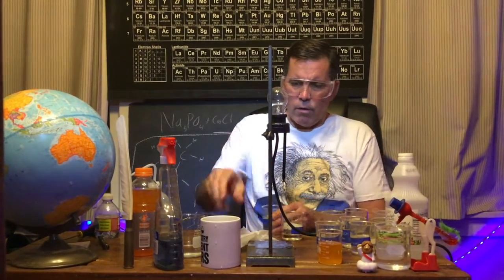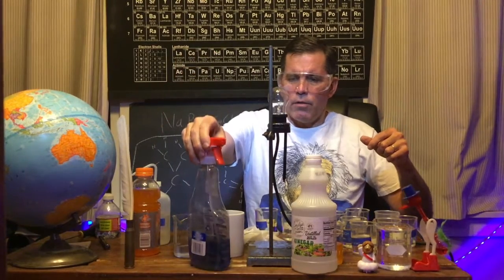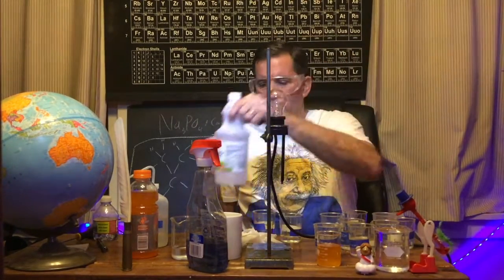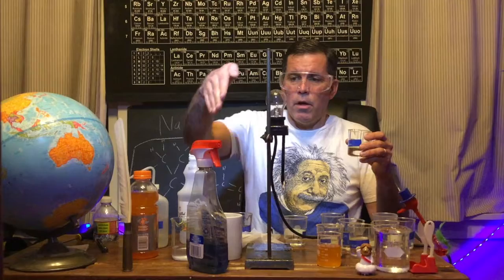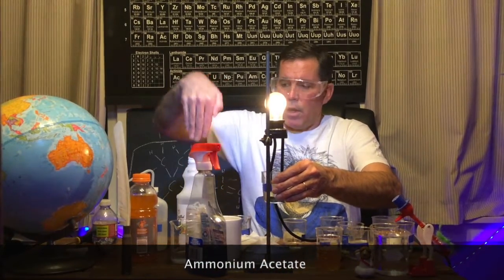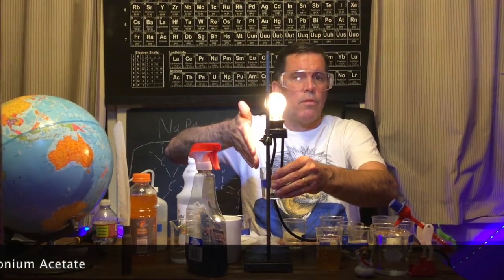What happens if I take the acetic acid in vinegar and the ammonia in Windex and react them? I react a weak acid and a weak base — I'm going to get a salt. When you react acids and bases you get a salt, and this salt would be ammonium acetate. Here it is — ammonium ions and acetate ions. We reacted two weak electrolytes and got a strong electrolyte. Anytime you react an acid and a base you get a salt, and if that salt is soluble it's going to be a strong conductor.